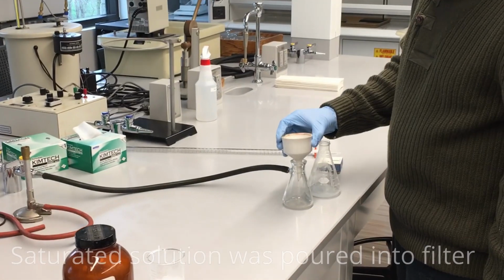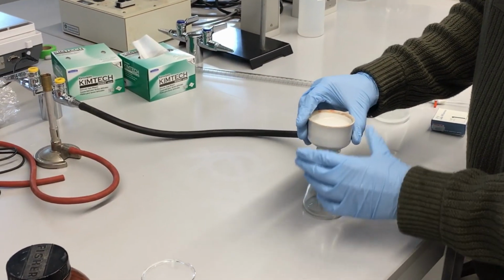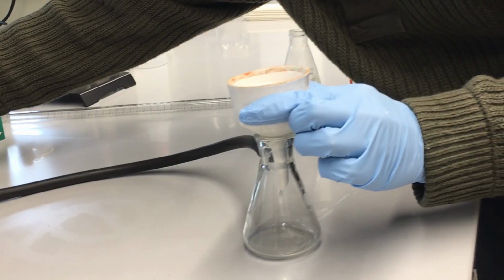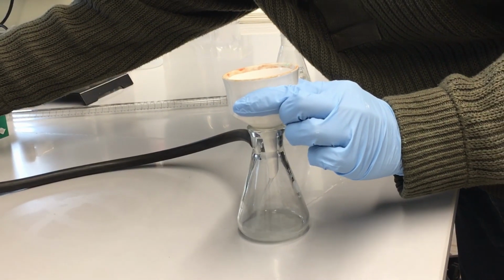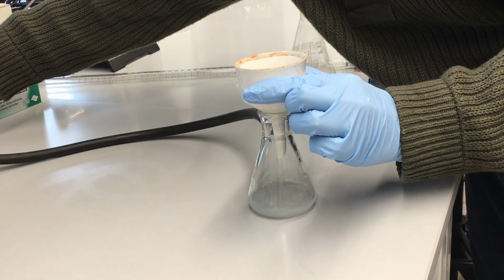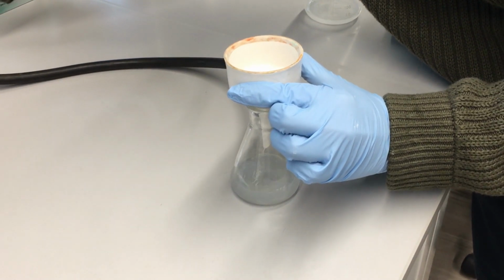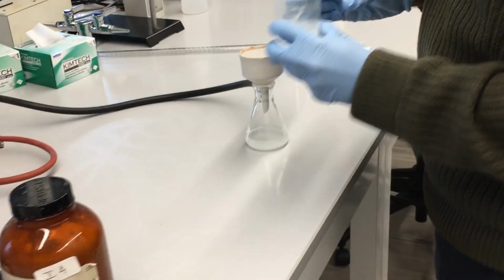We're going to place this filter funnel on top of an Erlenmeyer flask attached to a vacuum tube. So this is what we call vacuum filtration. We're going to use the vacuum from the vacuum tube. We can turn it on right there. That's going to force air through the top of that filter paper down into that Erlenmeyer flask. And you can see that that forces the aqueous solution to be pulled straight through. We can watch it very quickly go through here. Normally, this would take several hours, but by using vacuum filtration, we can do this process in a few seconds instead. So the force of the air from the vacuum helps us push that through.